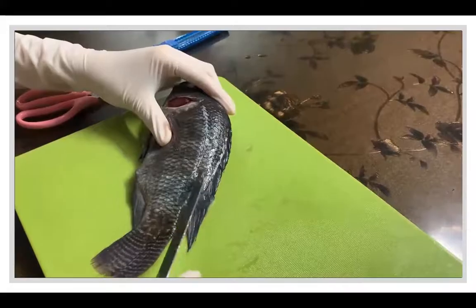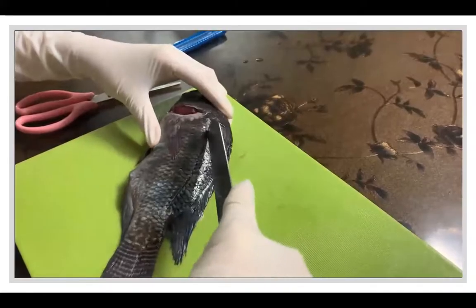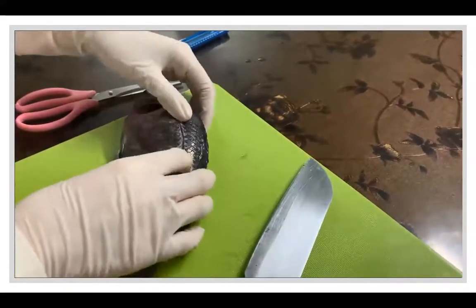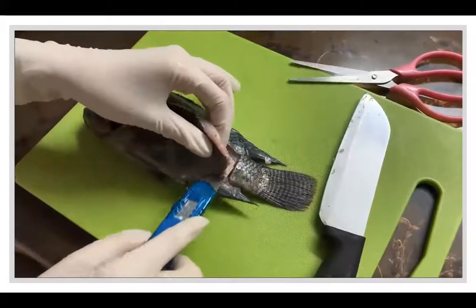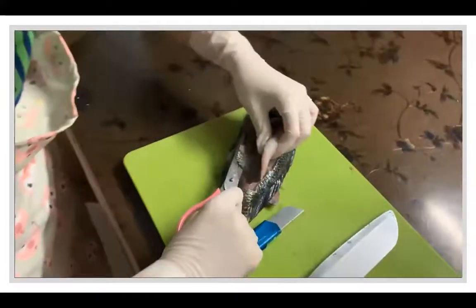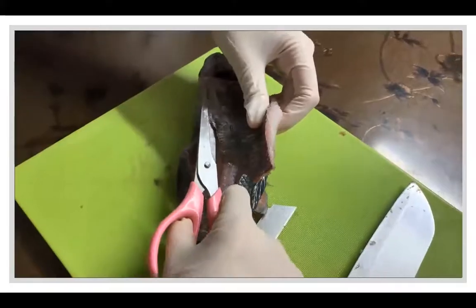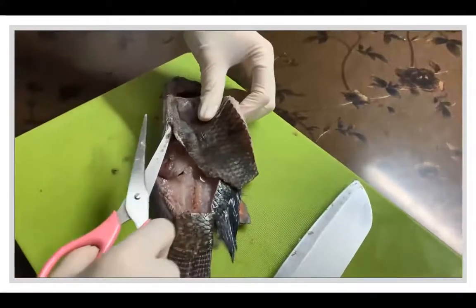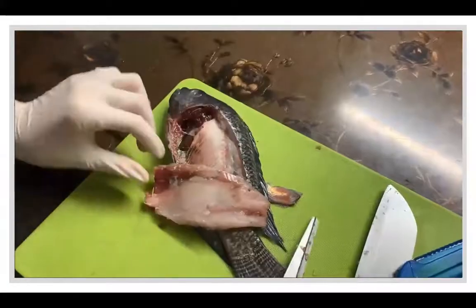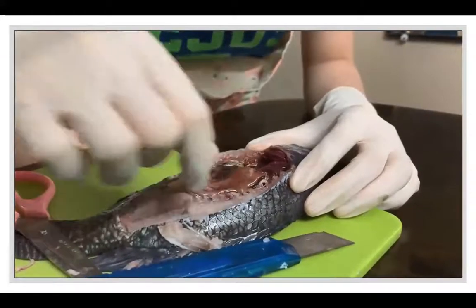Cut a lateral line up the side of the fish, then slit down on both ends of the lateral lines. Then make a long shallow cut on the bottom side of the fish; this cut will run from the anus to the gills, or vice versa. We must ensure that we do not cut too deeply into the body or else we will destroy the fish's organs. We can use scissors to help make cuts through the skin and muscles. After making the cuts, carefully lift the flaps to expose the internal organs.